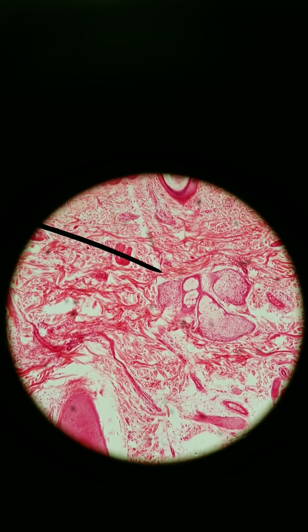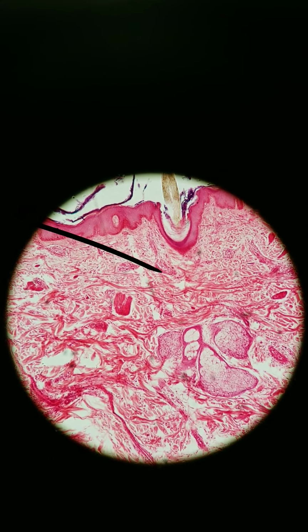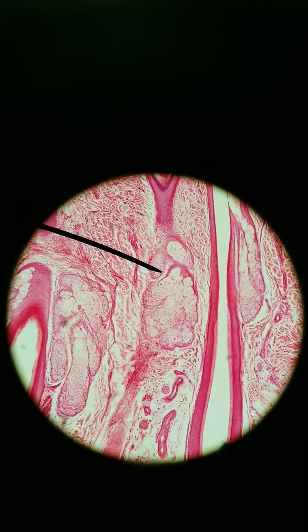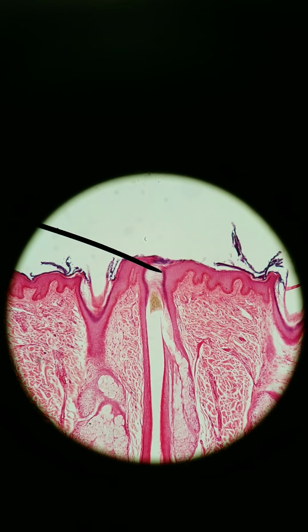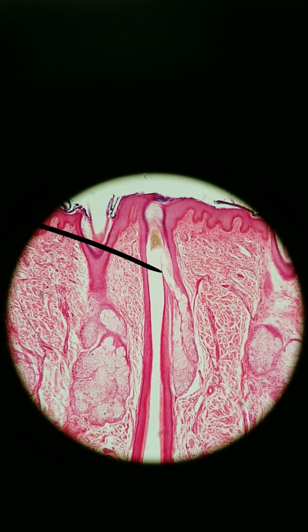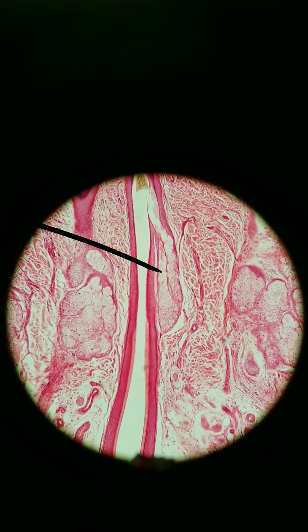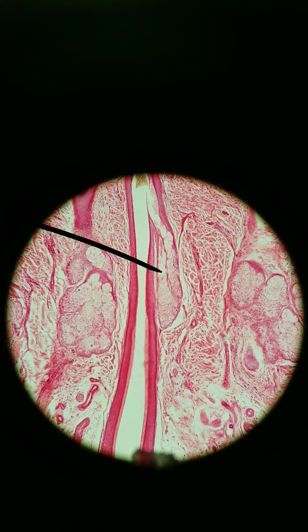Since we are also in thin skin with hair, we can find several glands, a couple glands here. Let me find a good example. Well, there's a lot of examples, but here we go. Here we have our hair follicle, and this is the hair cavity, where the hair would be. Next to hair follicles, you can typically find sebaceous glands. Sebaceous glands are clusters of light-colored, grape-like glands that secrete sebum into the hair follicle. Sebum and these sebaceous glands, they're released by holocrine secretion, meaning these cells are constantly growing and then bursting, growing and then bursting.